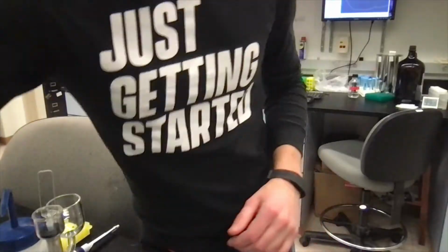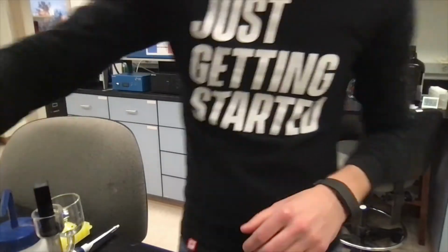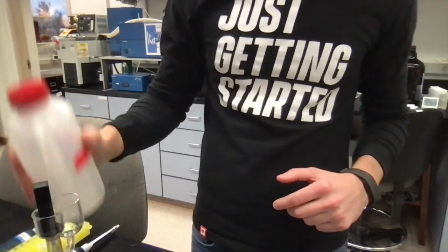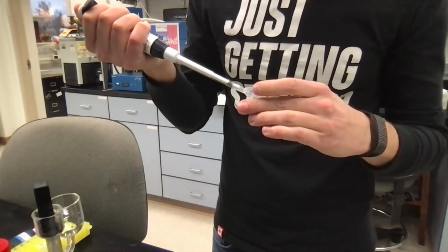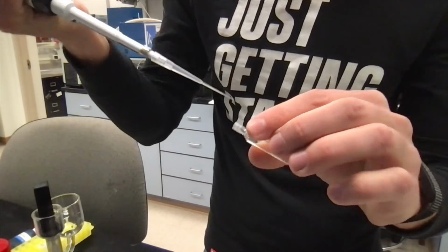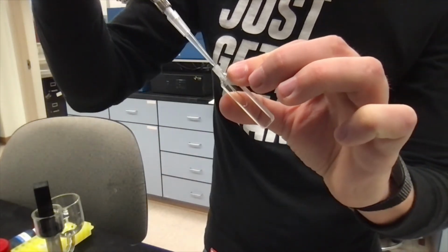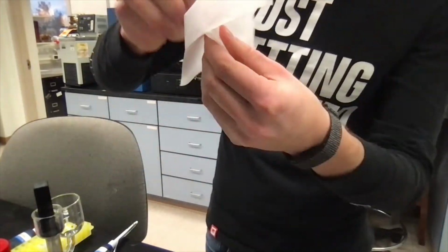Now we're going to use a cuvette to actually test our samples. So we're going to make sure to clean that out with water and acetone. And then we can load in 200 microliters of our buffer solution to this cuvette. And you can see we have to do this pretty carefully. We don't want any air to be trapped in there. And we're going to gently tap it down before loading it into the system.